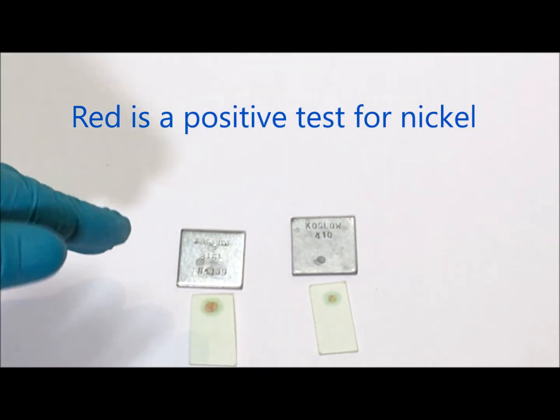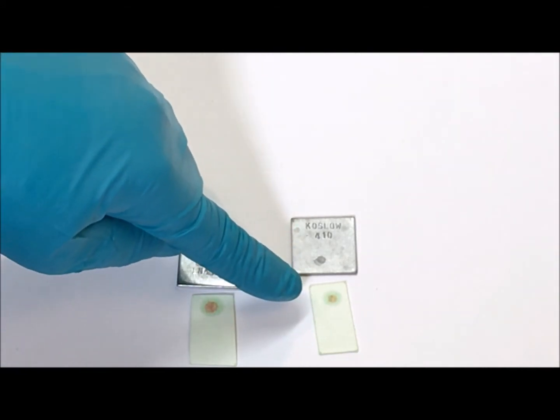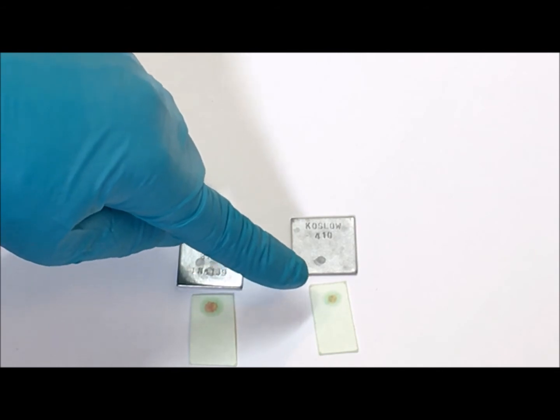Really within a second I could see a pink spot on this one. It's a pinkish red color, and this not at all. It's a little bit brown.